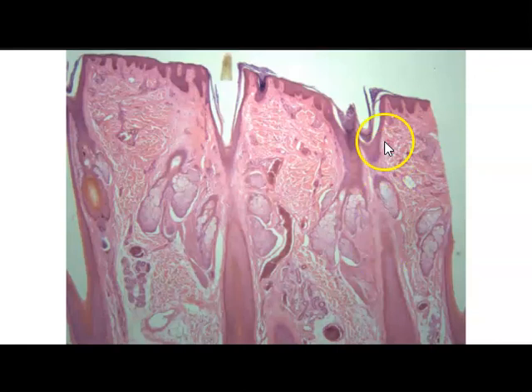Again, we know that this is thin skin. We have the epithelium, the keratinized stratified squamous epithelium within the epidermis, and then the different layers of the dermis. We have the papillary layer of the dermis, and then the reticular layer, each having different types of connective tissue. Again, these opaque type cells make up the sebaceous glands. And then we have simple cuboidal type groups of cells. These are your sweat glands. And then you can see part of the hair follicle with the hair root, and then just a little bit of the hair shaft.